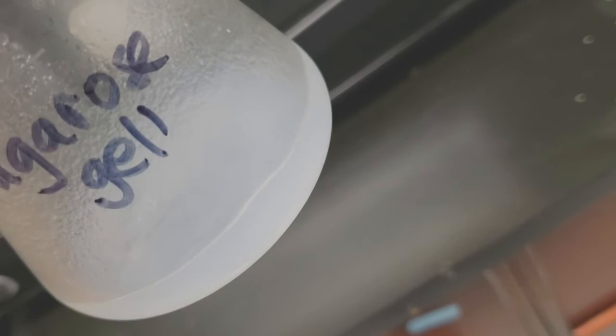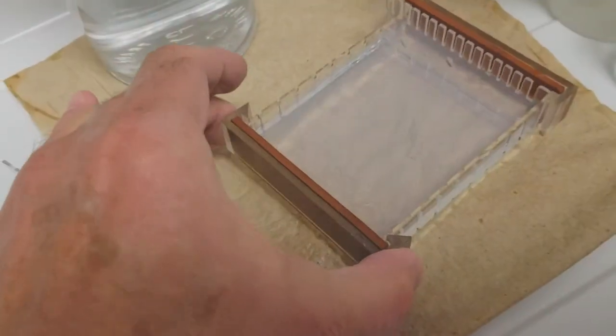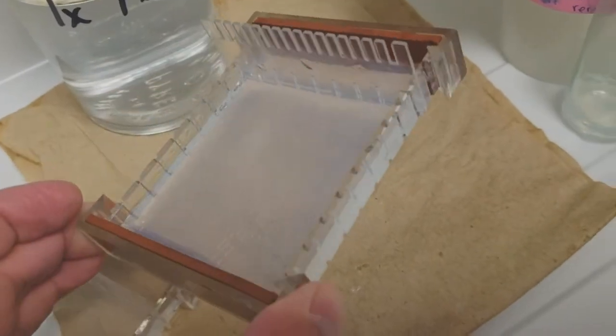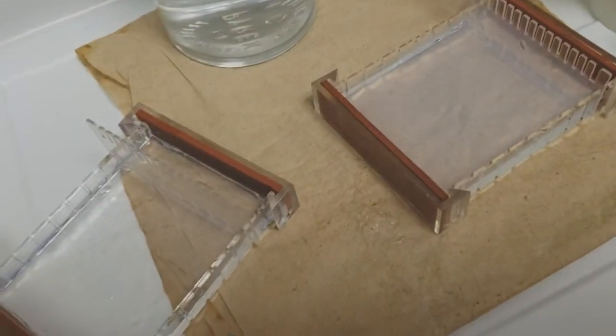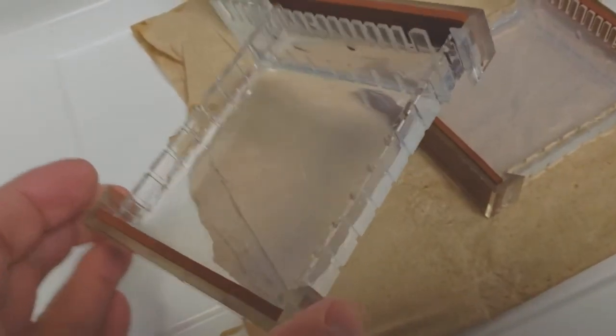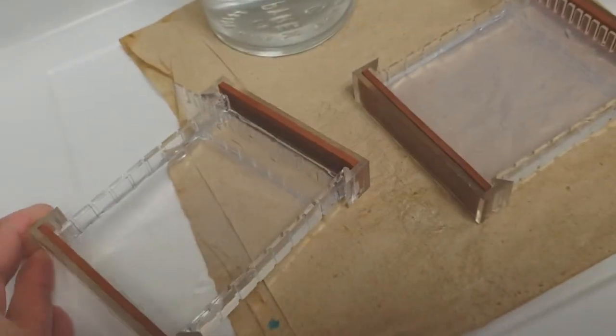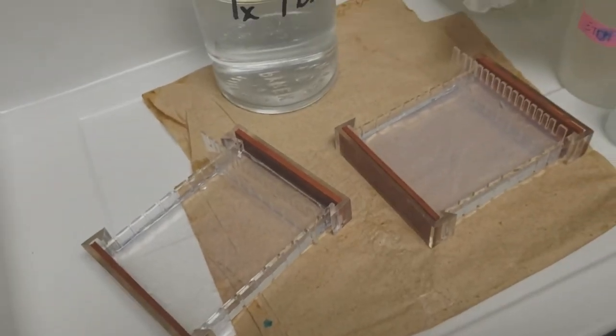Please disregard. So I reheated the agarose and repoured it, and now it has the gelling power that I originally wanted and that I did not get. That seemed to be the answer.